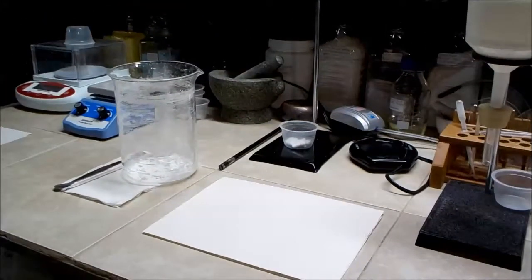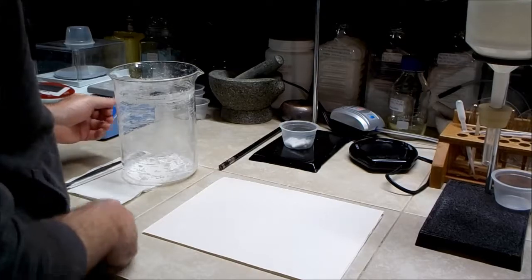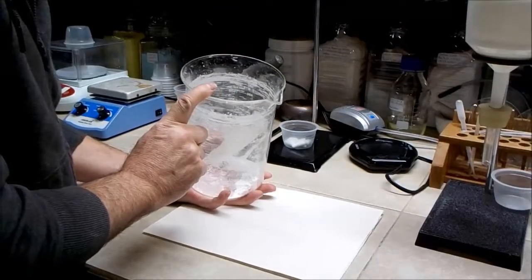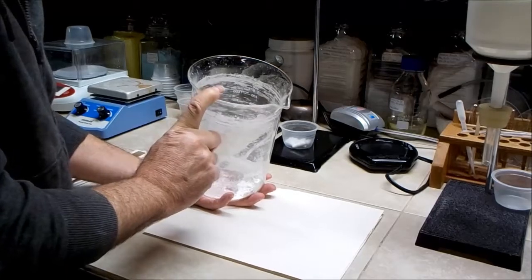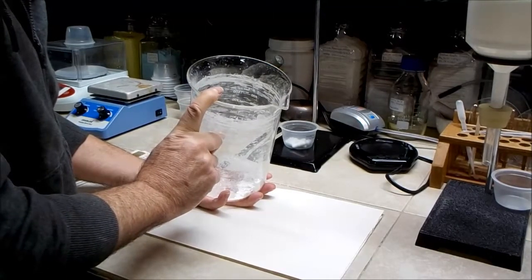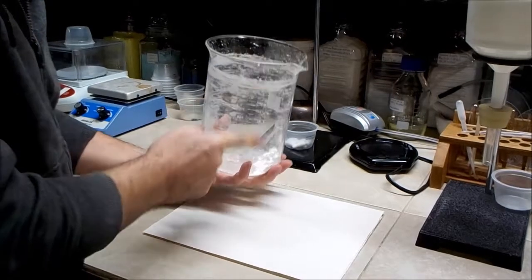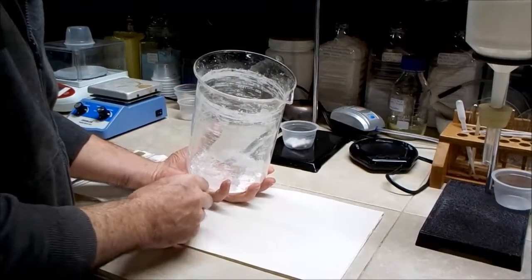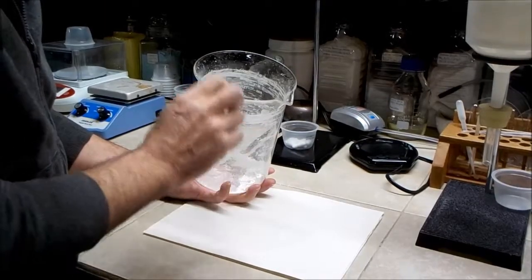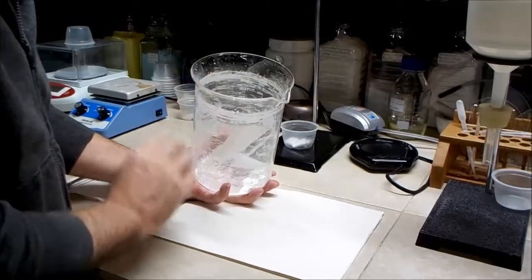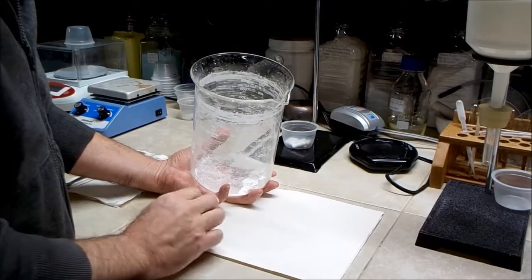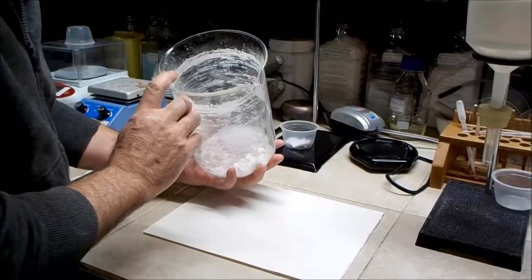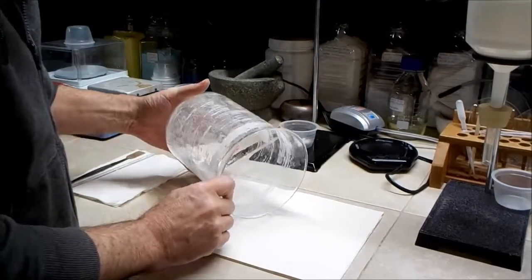So I'd like to say a few things about drying the calcium hydroxide. I don't recommend using the beaker like I did in boiling it, as it starts to get drier and thicken, it starts to splash and splatter a lot. Fortunately that height, the beaker contained most of it, but it was still problematic. And then when it got down near the end, little pieces started flying around like popcorn. So I would recommend doing this in a shallow dish and under gentle heat and don't boil it. And I had quite a time getting it off the side of the beaker and there's going to be some loss from that, so I'd recommend not doing it this way.